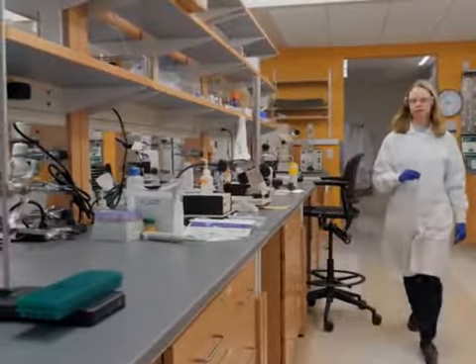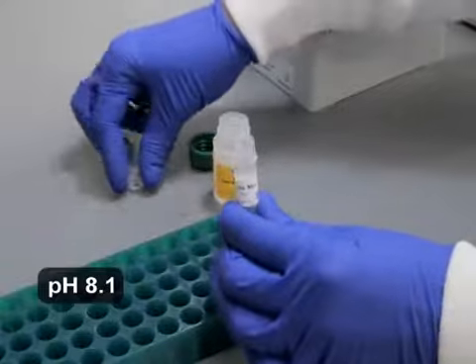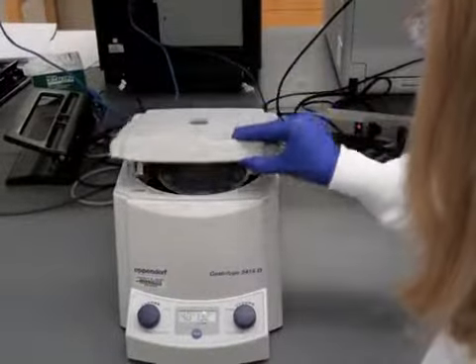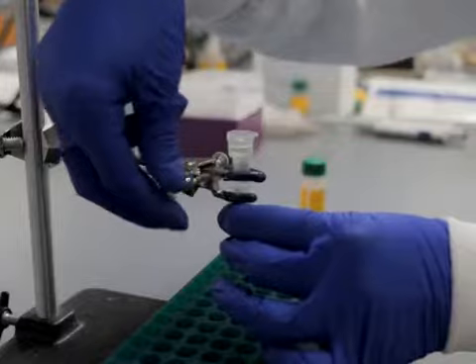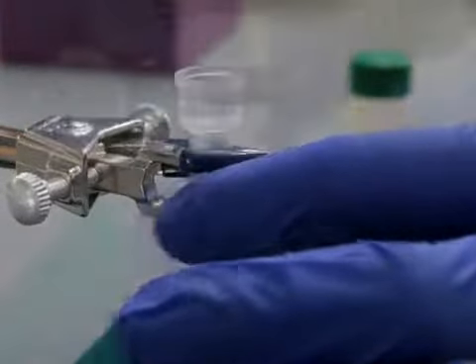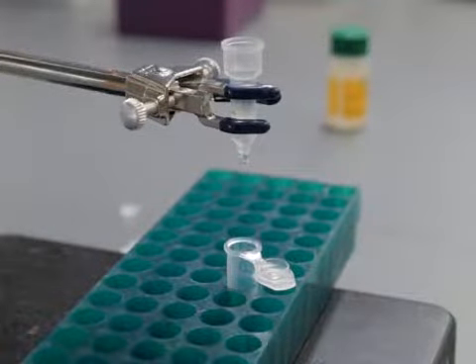First, to prepare the protein mixture for separation, add 0.2 milliliters of binding buffer and vortex to mix thoroughly. Then, centrifuge the mixture to remove any froth. To prepare the cation exchange column, clamp it vertically onto a ring stand and allow the resin to settle. Open the top cap of the column and then the bottom. Allow the buffer to drip out under gravity into a tube below.